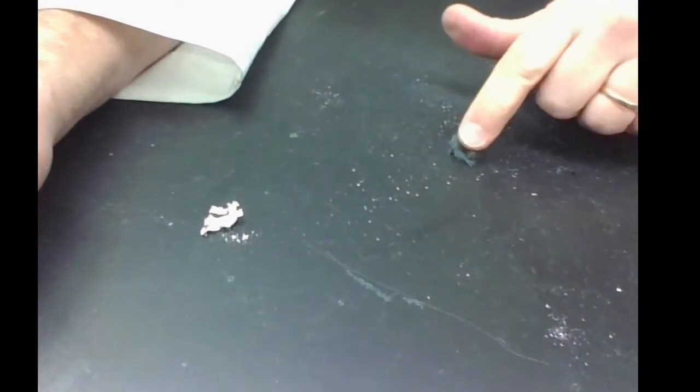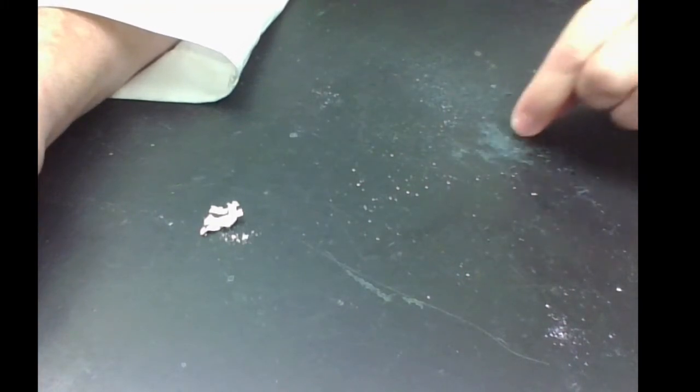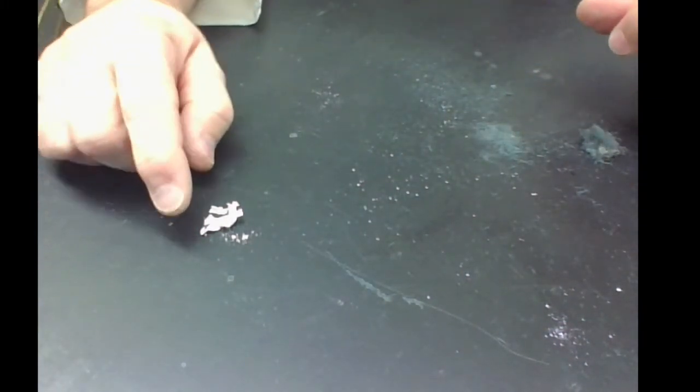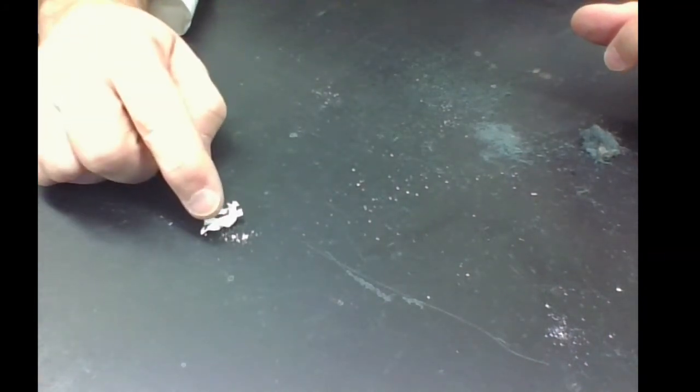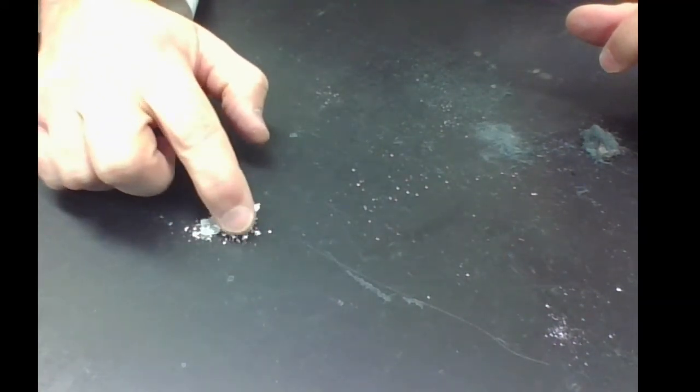Now for the magnesium, I'm going to lower the camera so that you can see it on the black lab table. I want you to notice how it looks. Here was the iron — it's into a powdery dust right now because it is no longer iron; it is iron oxide. And here — remember what the magnesium looked like before? Now check it out: it's white and powdery. Why? Because it's no longer magnesium. What is it? It's magnesium oxide. It is now a compound. Have the physical properties changed? Record that in your observations.